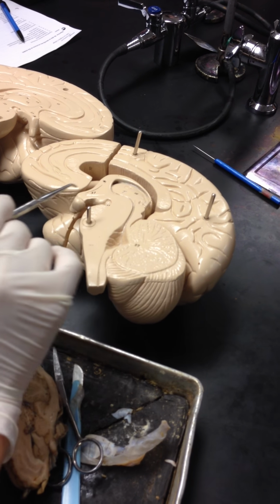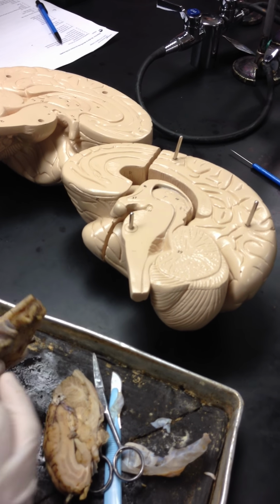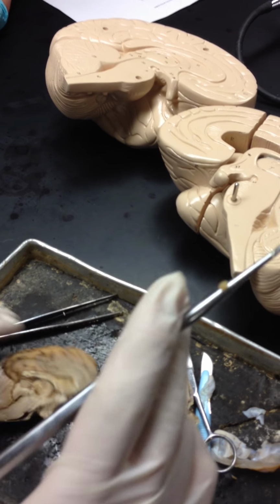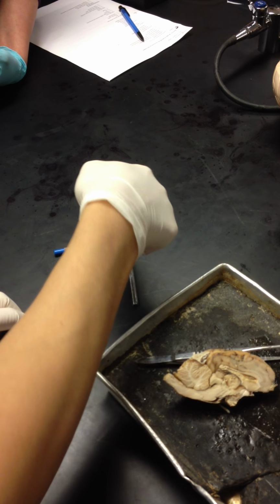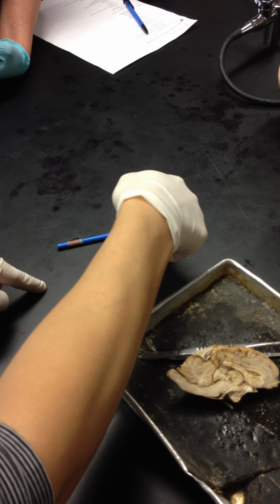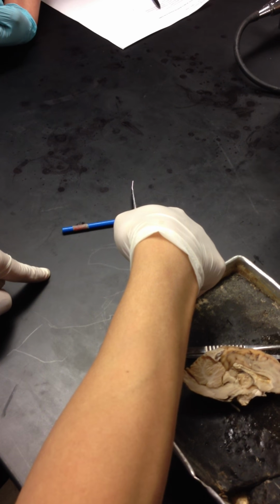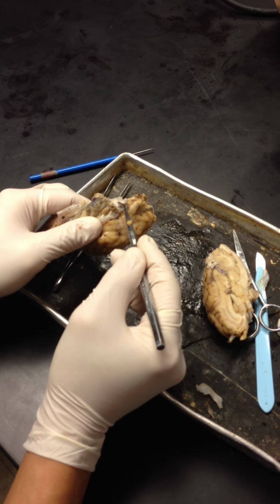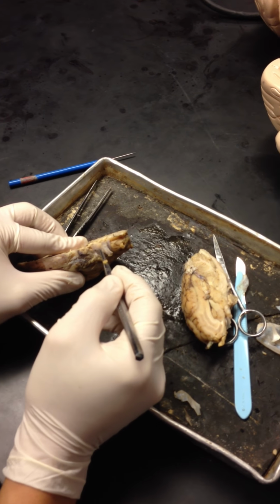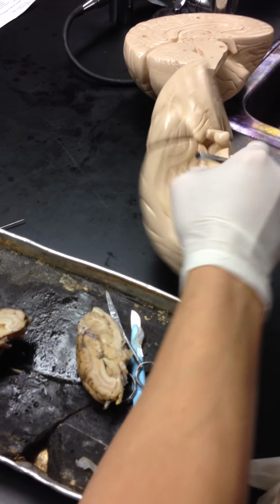Now we're going to move down to this thing. This is known as the optic chiasm or optic chiasma, depending on which book you use. This is the optic chiasma. And the way it goes is this, you're going to have two things. You have the optic nerve, optic chiasma, optic tract. Optic nerve, N, optic tract, T. N comes before T. So you have the optic chiasma, optic nerve, and optic tract will be in the back. All right. Now we move down. So this is optic nerve, optic chiasma, and the optic tract is right here.